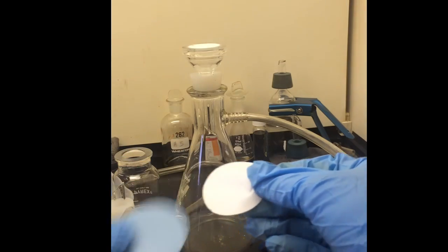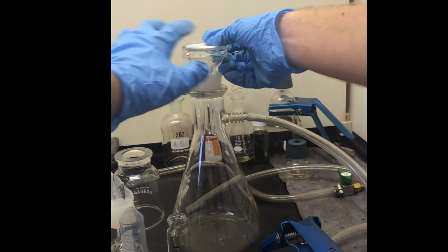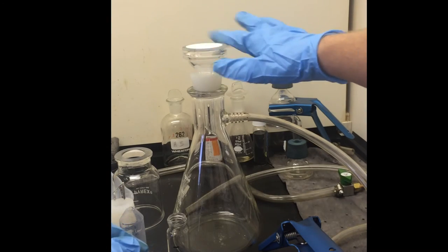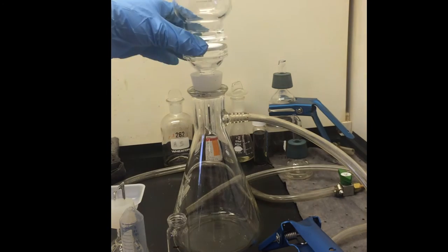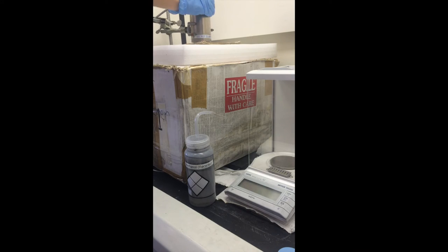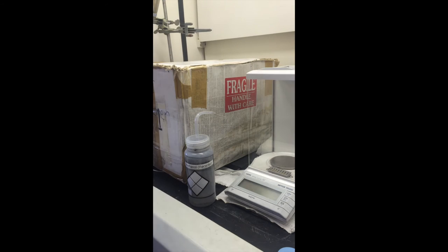Once sonication is complete, the filtration apparatus is assembled with a vacuum filter flask and a membrane. The membrane is smoothed over the flask. With the help of the vacuum, the membrane creates an excellent smooth surface, which will produce a cleanly made felt. After the membrane is placed, the cup which will hold the nanotube suspension is clasped into place.